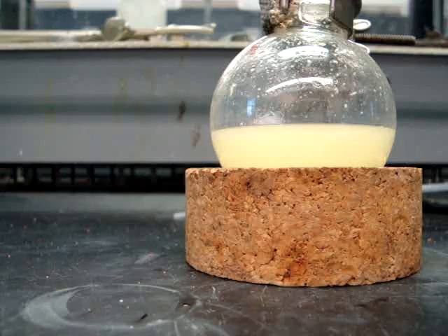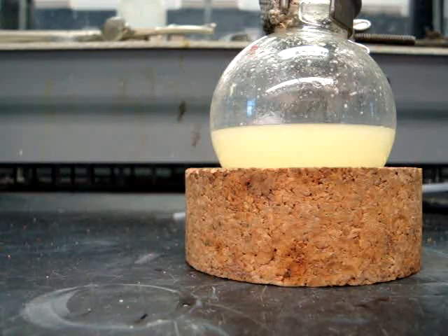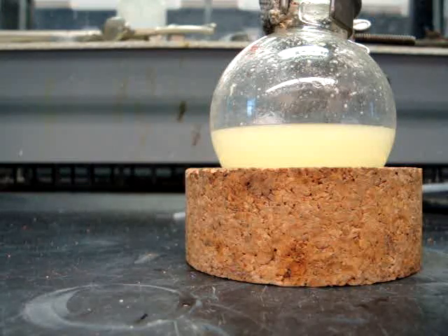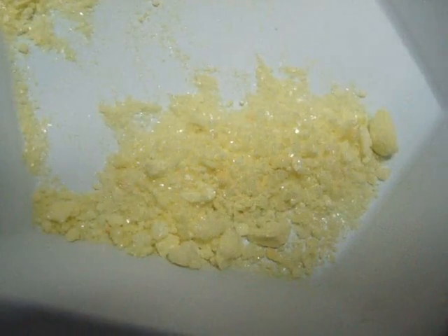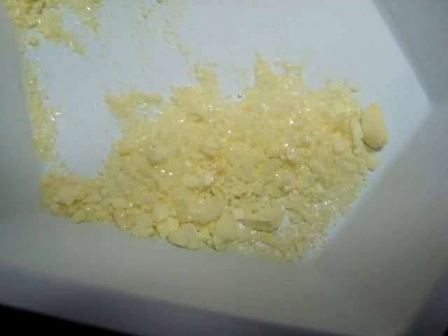Now you will determine the weight of the dibenzylideneacetone and its melting point. If you have any questions regarding how to determine the product's melting point, refer back to the video discussing melting point. This is what your final product should look like. Keep in mind that the melting point of your final product should be in the range from about 110.5 to 112 degrees Celsius.